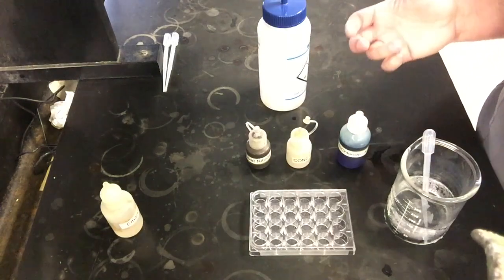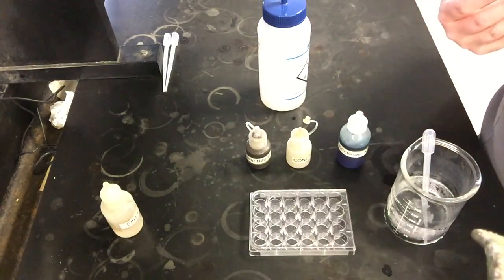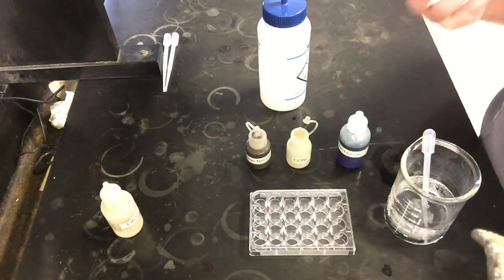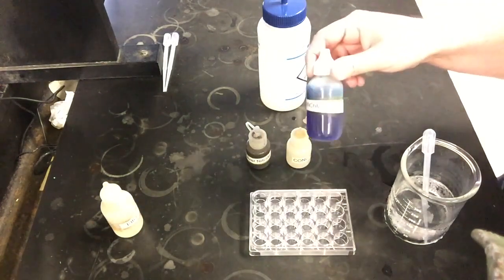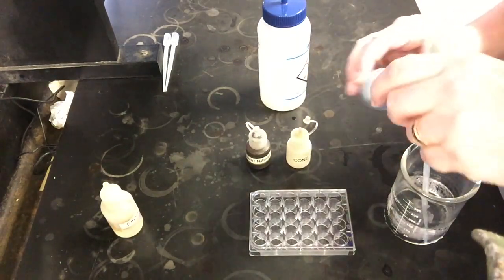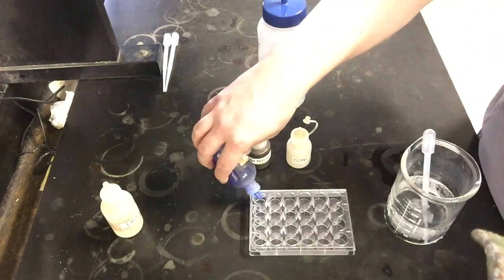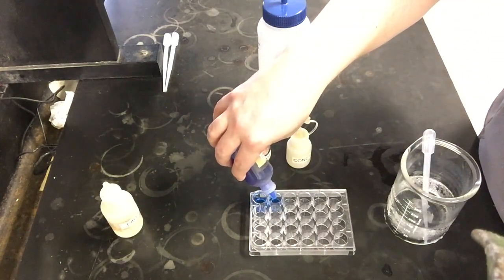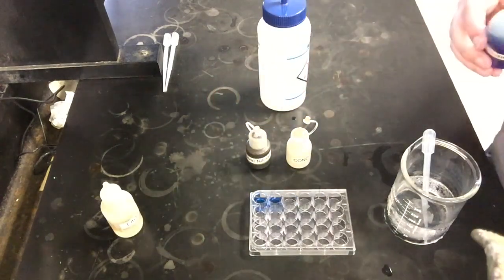So we're going to take a look at what happens to this cobalt chloride compound when we add water. It's going to form a new complex, it's going to have a different color, and the visual color of the cobalt compound itself is actually going to help us figure out, do we have more reactants or more products? Because initially we can see reactant-wise it's going to start out this nice, pretty royal blue color, and then when we go to add water to it, we're going to see what happens as far as getting a color change.